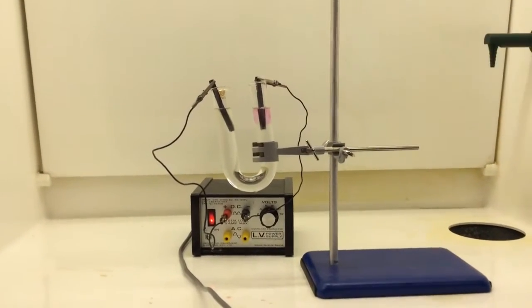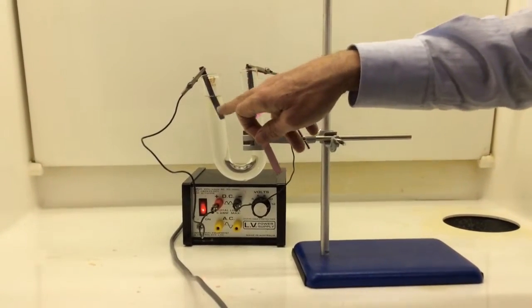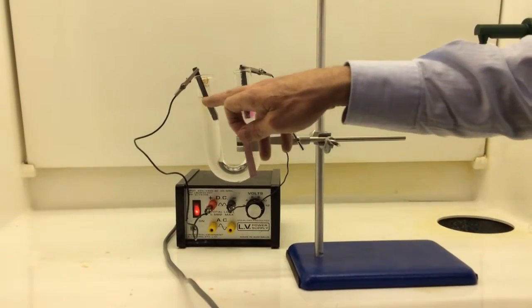We've got something being produced there. This is turning slightly yellowy, I don't know if you can actually see it, it's yellowy-greeny there.